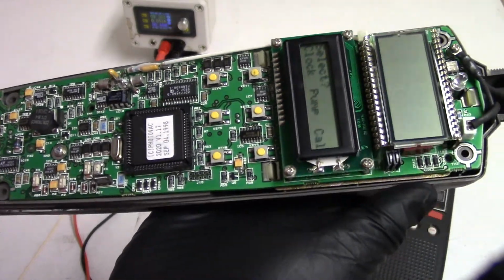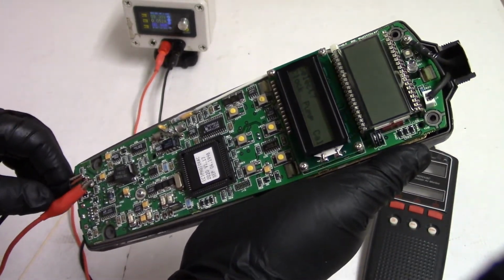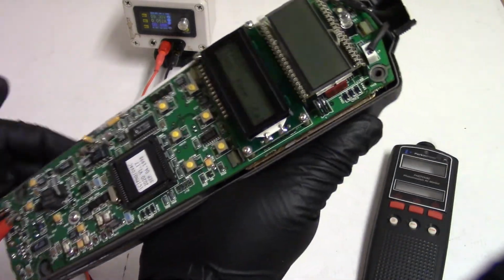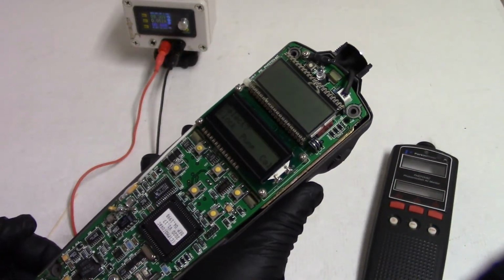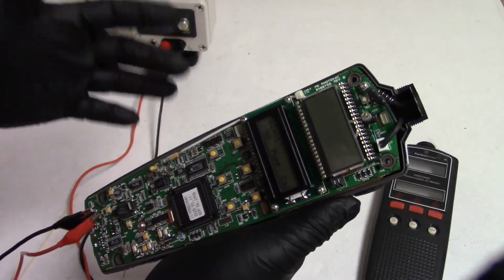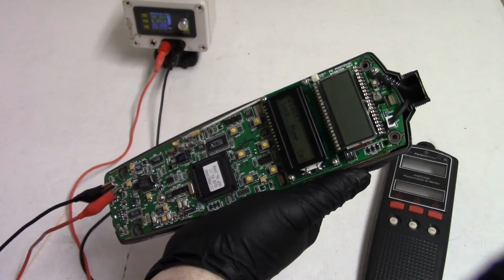So, this thing's kind of neat. I'm going to keep it. I'm going to figure out a way to power it, maybe lithium batteries or something. I'll get a new connector and maybe I'll 3D print a cover for it. But it's kind of cool to have something that you can use for detecting volatile organic compounds. It doesn't tell you what those compounds are, it just tells you if they're there.